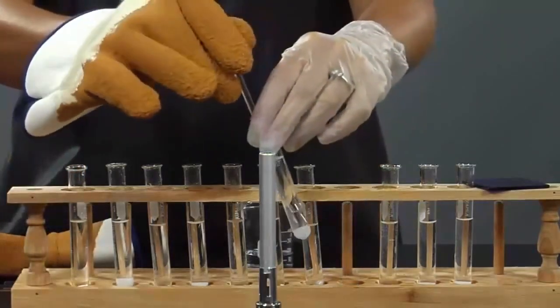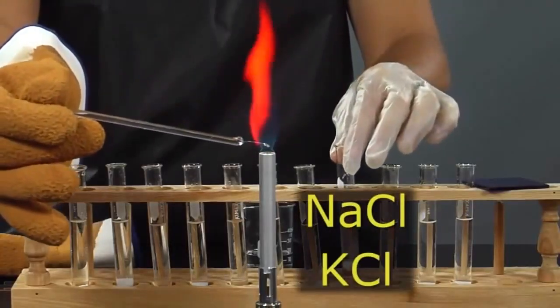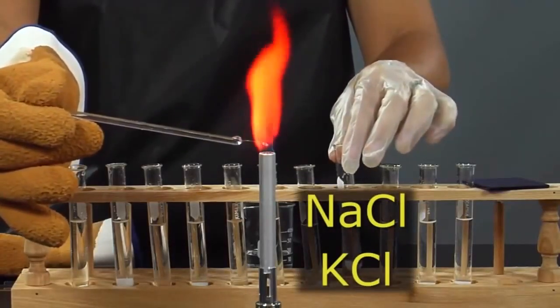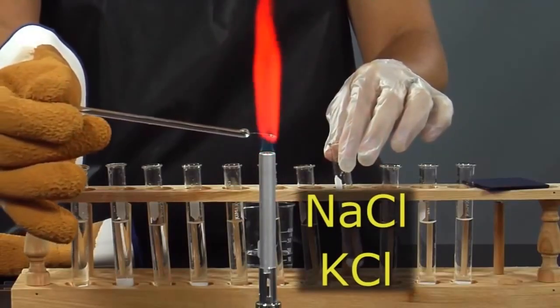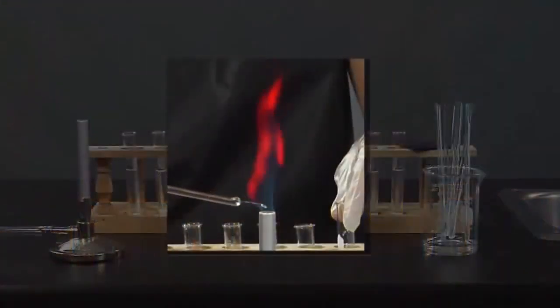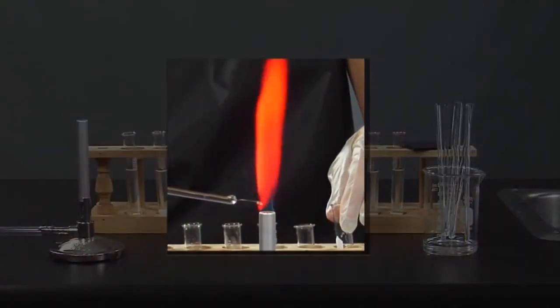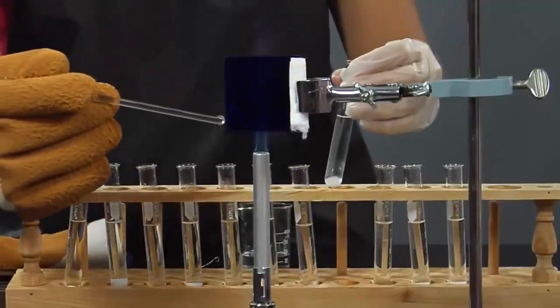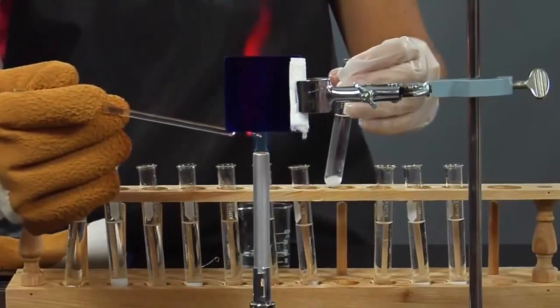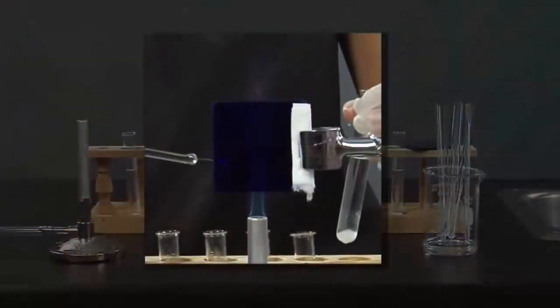Now we will test a mixture of 2 different metals, sodium chloride and potassium chloride. Notice that we obtain the same yellow color we obtained before when we were testing just sodium. Sometimes this may happen, and this color can mask other metals present. In order to check for other metals, we will look through a cobalt blue glass. The yellow color can be absorbed and reveal other colors and metals present in the solution. Now, what other colors can you see?